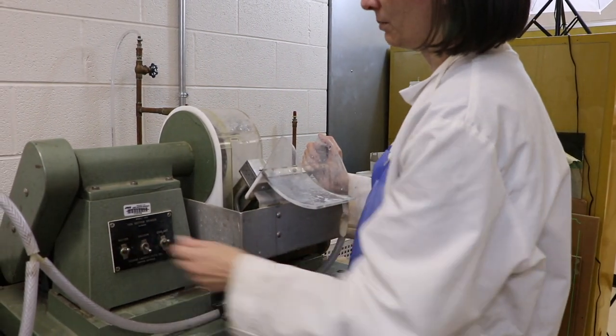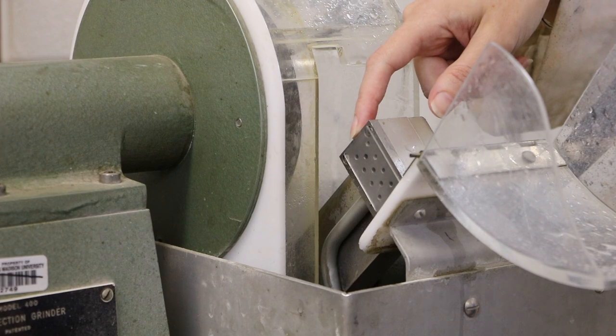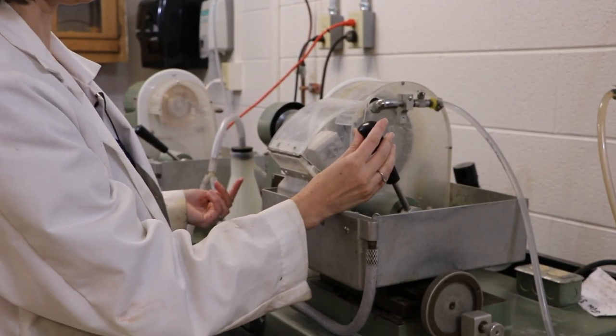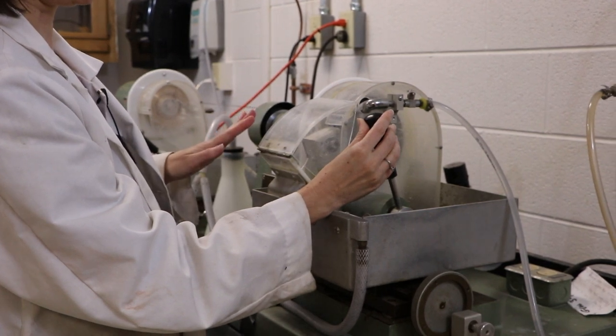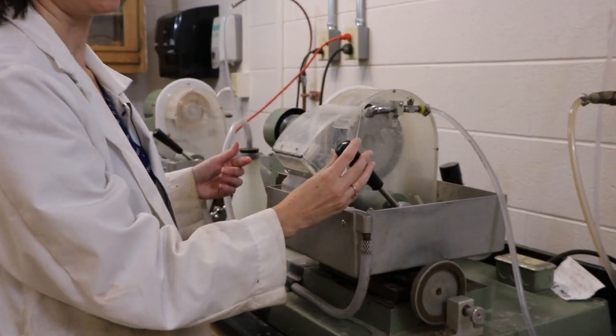We're going to turn the motor on, got the water on, and I'm just going to graze the surface of the slide, setting it up against the grinding wheel and trying not to catch the other end.